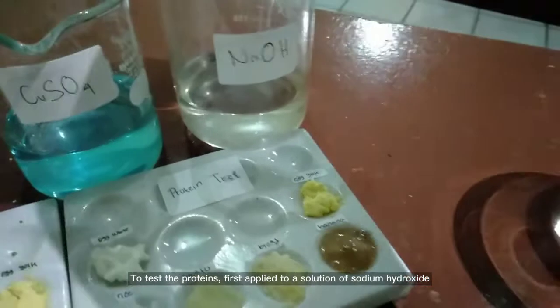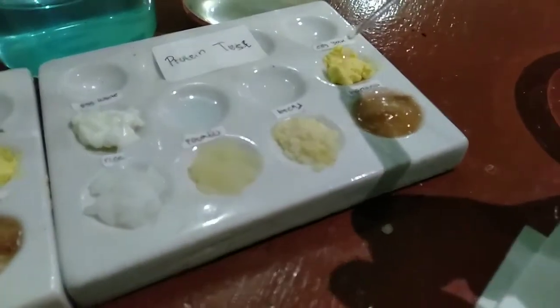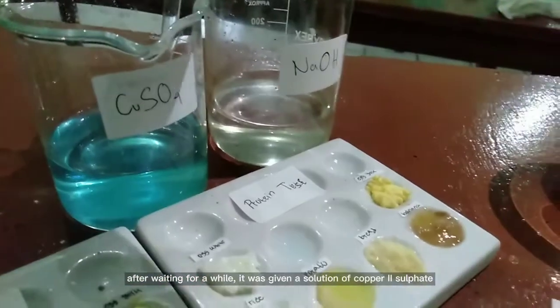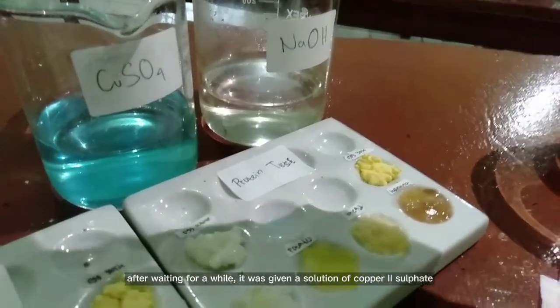To test the proteins, first apply a solution of sodium hydroxide. Wait a minute. After waiting for a while, it was given a solution of copper 2 sulfate.